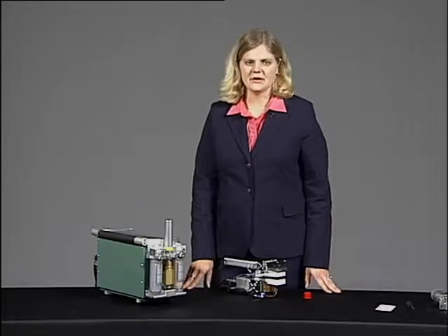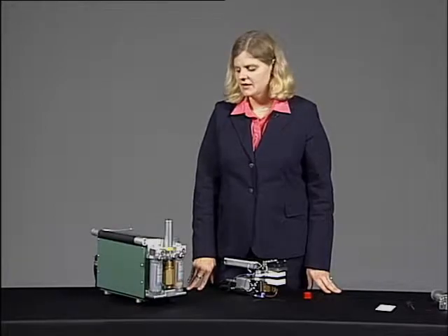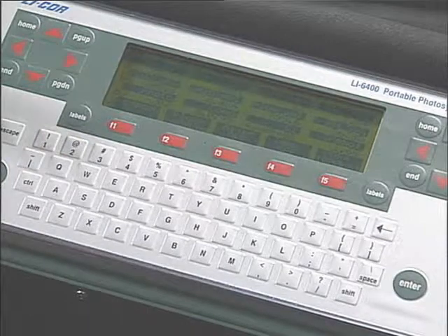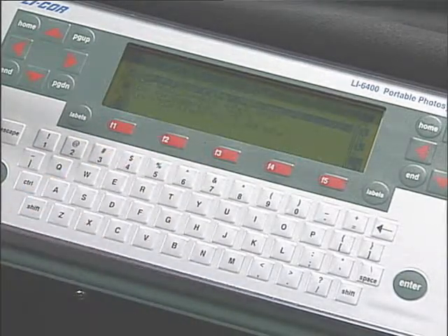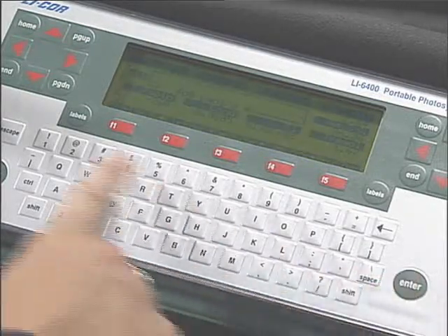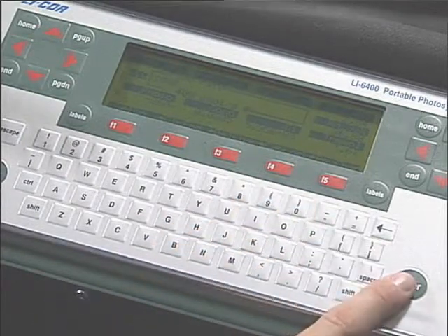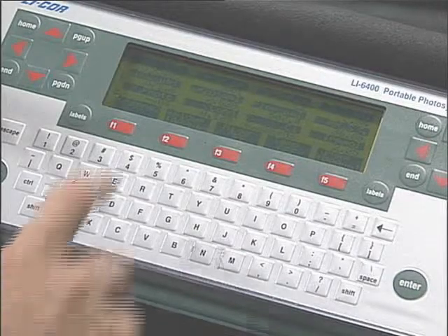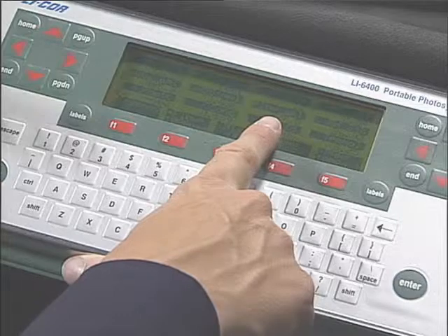Point number 2 in our daily preparation checklist is to check our maximum flow rate. To set the maximum flow, we need to go to menu level 2, F2, and we need to change our flow rate from its current value to 1,000. And if you look at line B in new measurements, the third parameter is your flow rate.